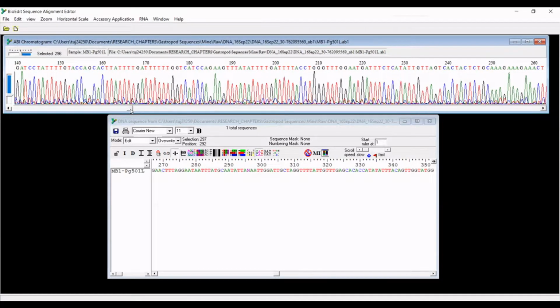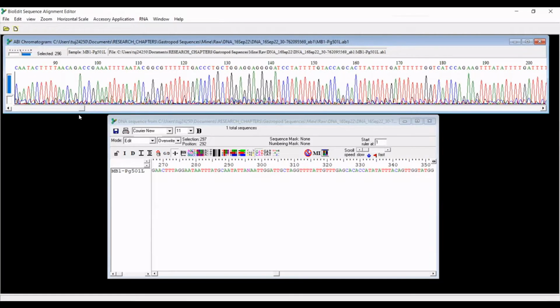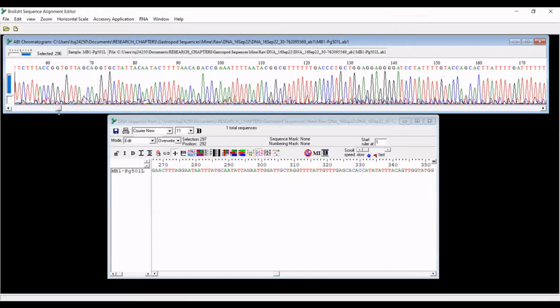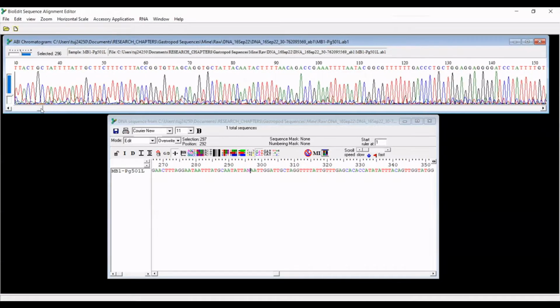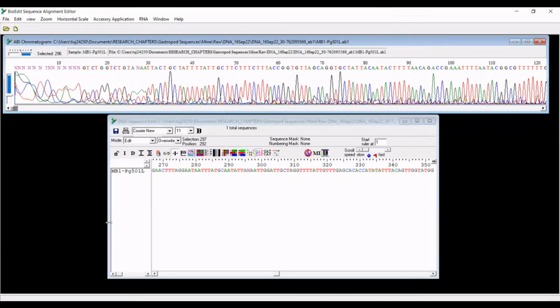And so most of these seem all right to me. Some are more messy than others, of course. You have a lot of background here, but you can still see that the most likely call is the one that they chose, which is G here. And so yeah, this actually looks all right to me. So this is not a super messy sequence, thankfully.